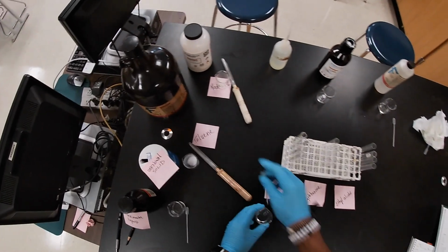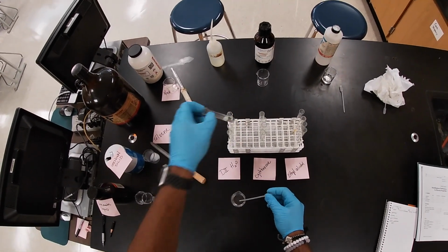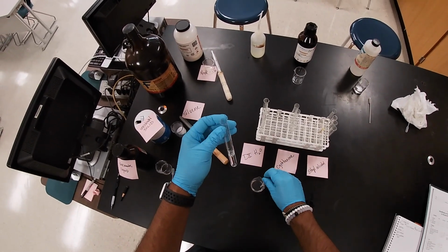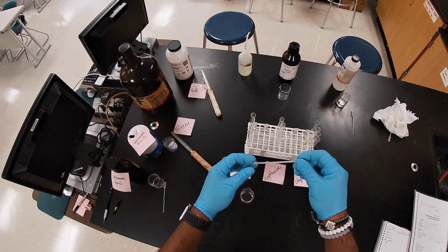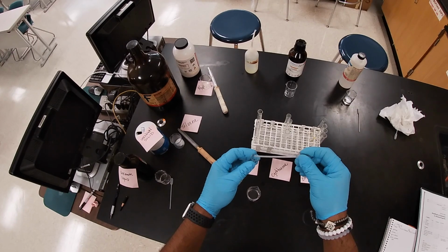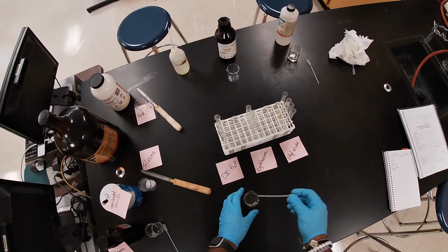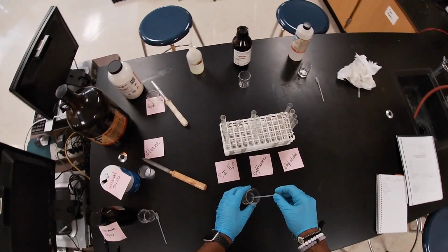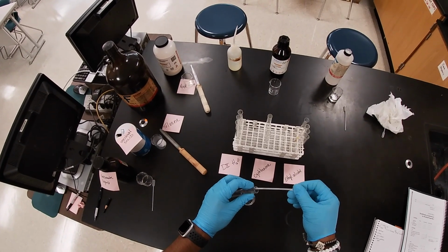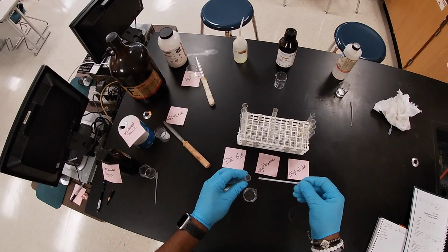Now the second column, right? We're gonna add some toluene. So I'm gonna add some toluene to water. Now remember that we have to add enough so that we can see if it dissolves into the solution. You also don't want to stick your pipette into the test tube completely because then you might run into contamination.